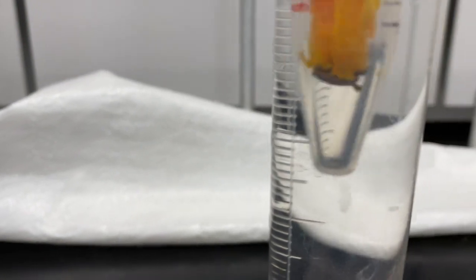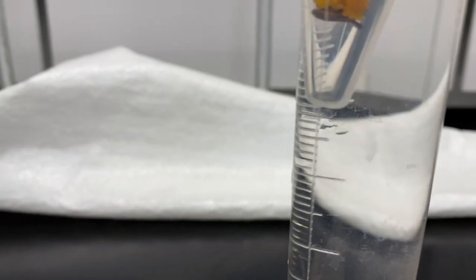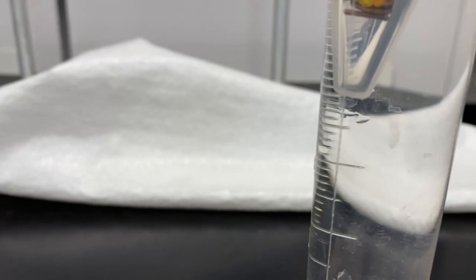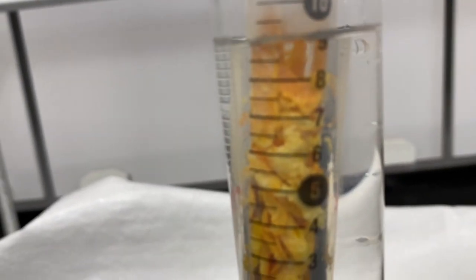Nothing came down towards the end, so it looks like we just have some frozen orange up top. Time to unpack the orange and add more dry ice.